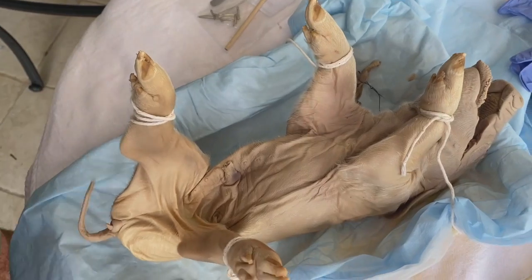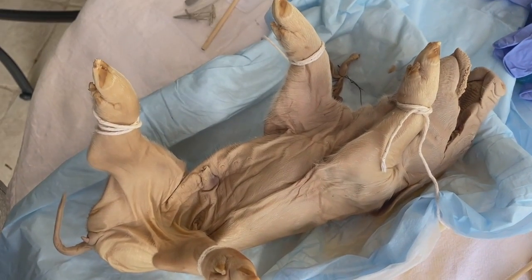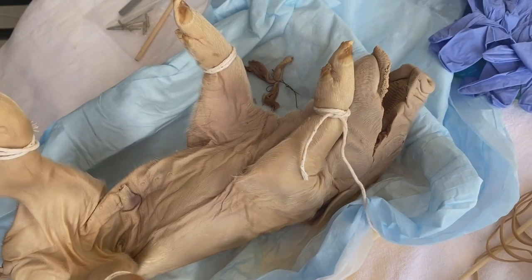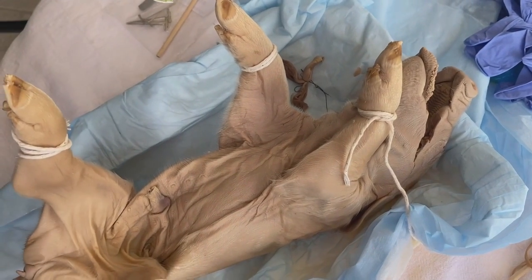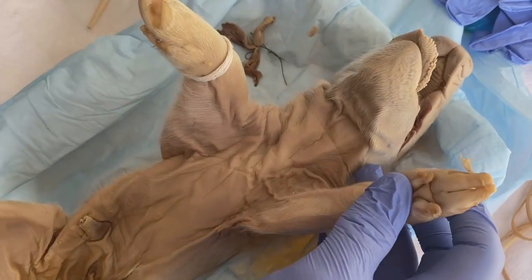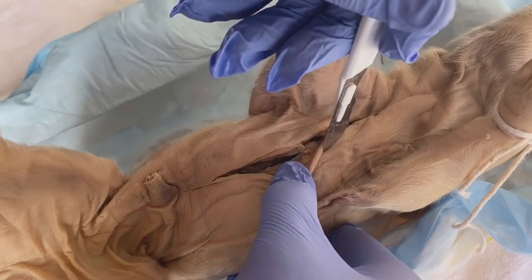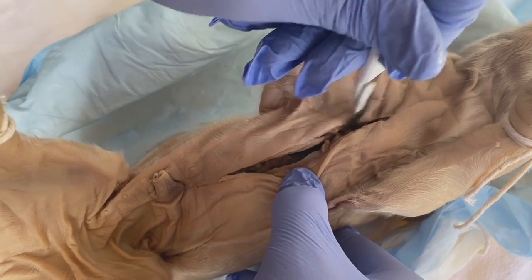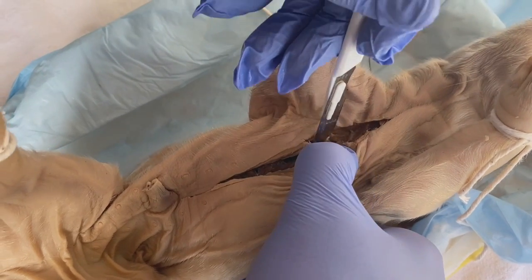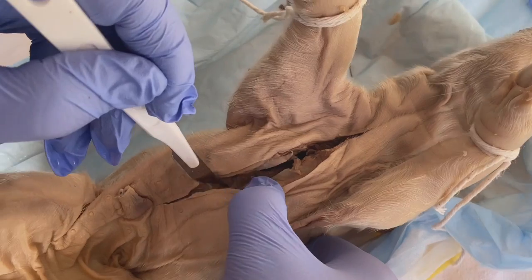We will now look at the internal anatomy of the pig. The first step is we need to make a cut just anterior to the umbilical cord and then extend it to the neck. And so you'll do it like so. And so it's important to be careful with this so that we do not lose any vital organs, and we cut only through the muscle and the tissue.